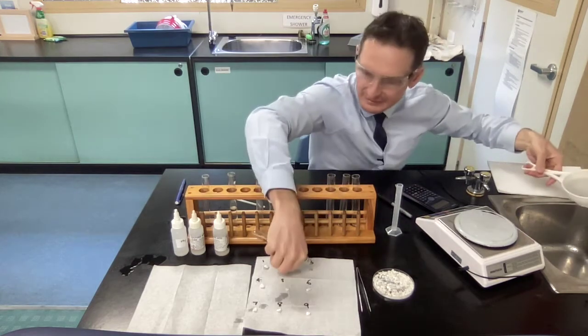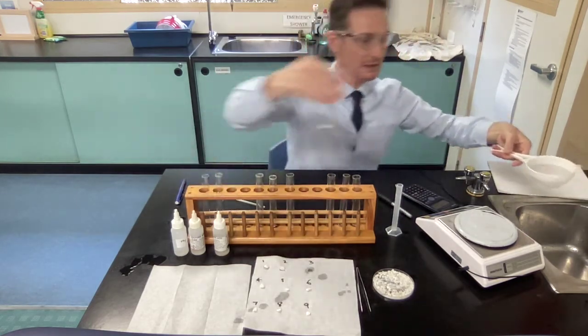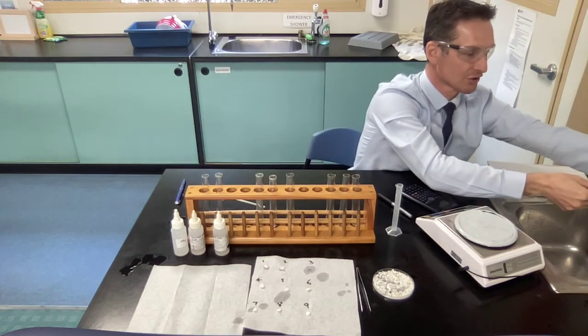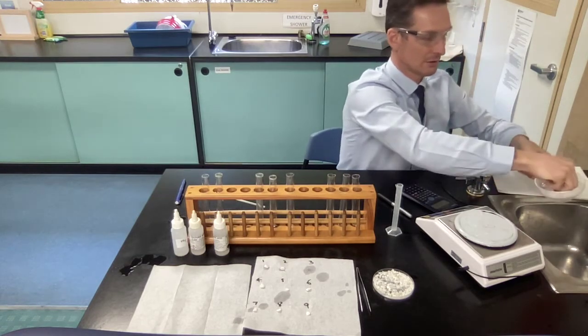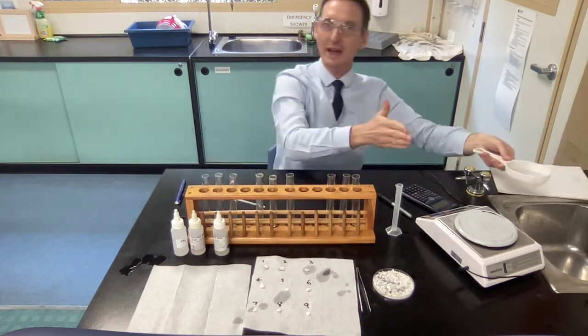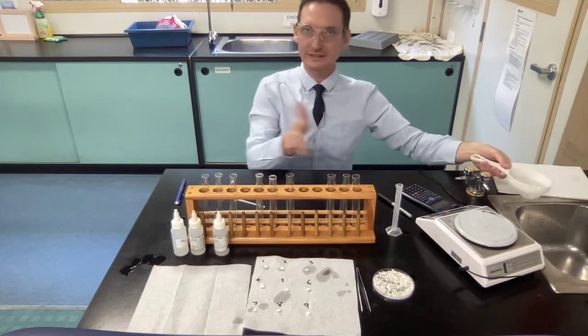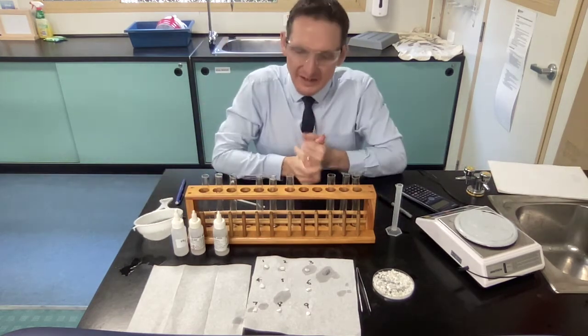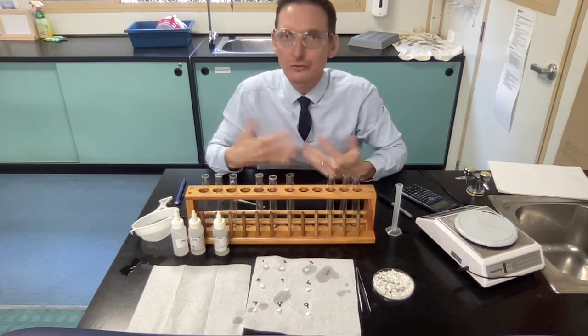Number 2 test tube, wash for 5 seconds. Gee, quick 5 seconds. And number 3. And the 5 to 10 second wash. Lovely. And you do that again for all 9 solutions with 9 rocks in it. Then that has now gone through a weathering process.